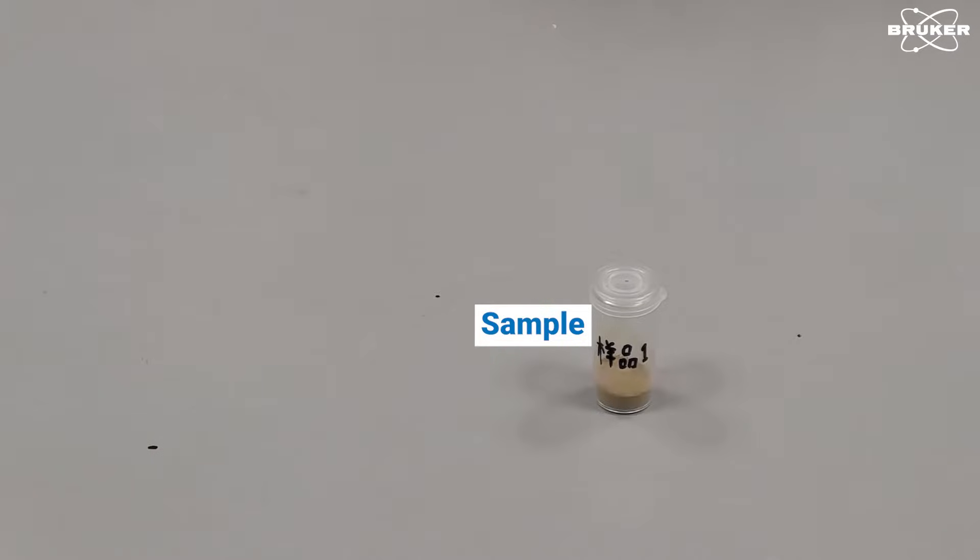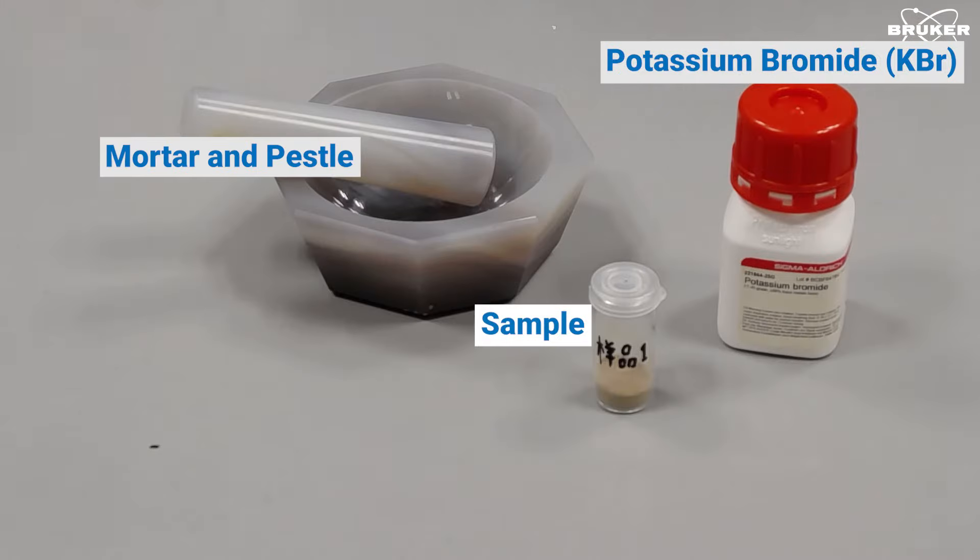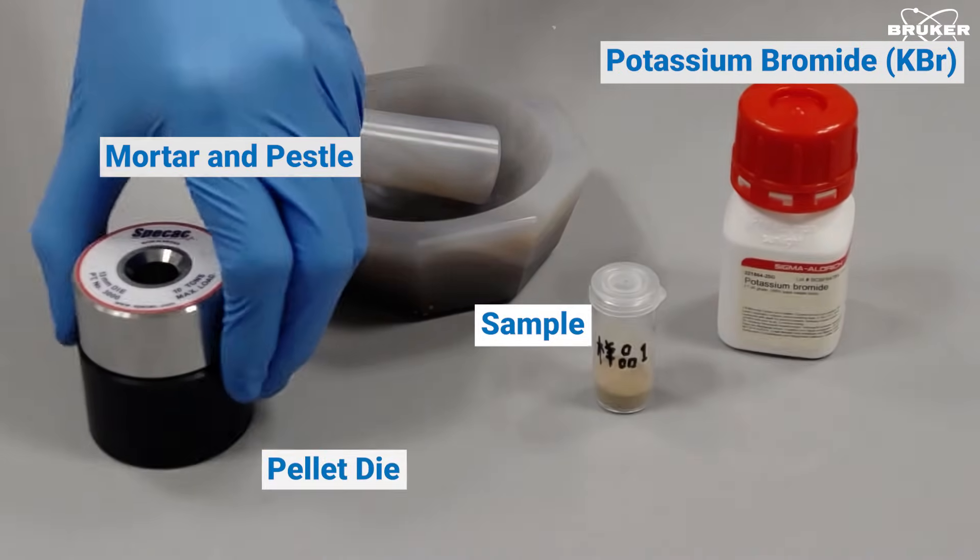Our sample material, potassium bromide, a mortar and pestle, and a pellet die.